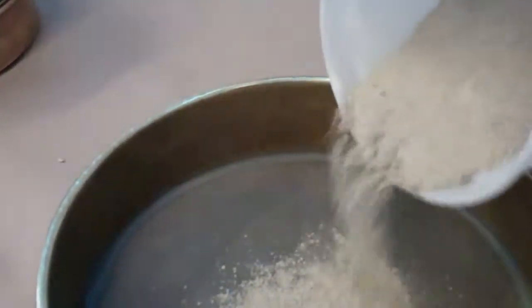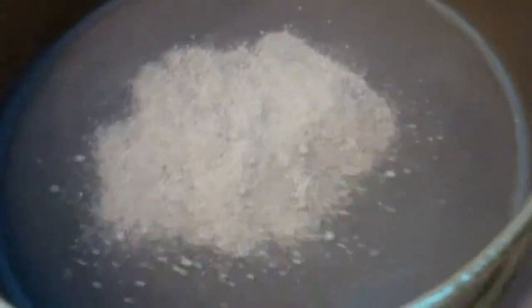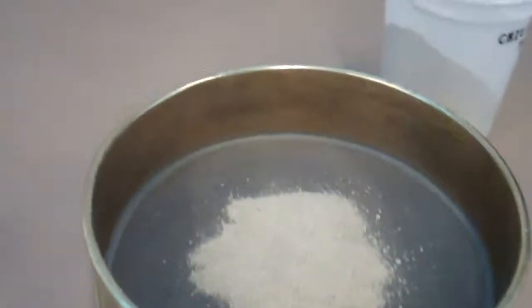So now I'm going to take this and put it into the dry sieve, which makes me think of when people had the gold rush and they were sifting through all of those stones to find gold — it's kind of the same thing. If you look closely, it's like a screen with specific size spaces in between. This one is 250 micrometers. So we are going to sieve this, and whatever comes out the bottom is finer than that and will go to the next sieve.